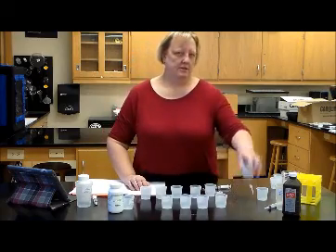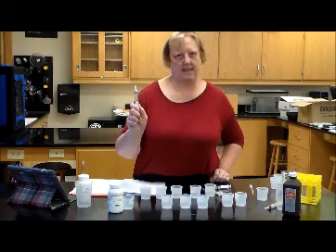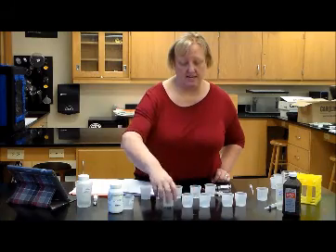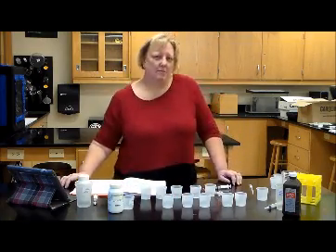So for the 10-second and 30-second, have that H2SO4 ready to go, because the 10 seconds and 30 seconds go pretty fast. The 1-minute one, the 120-second and 180-second, you've got a little bit more time, obviously.